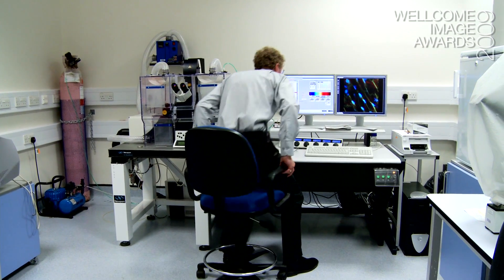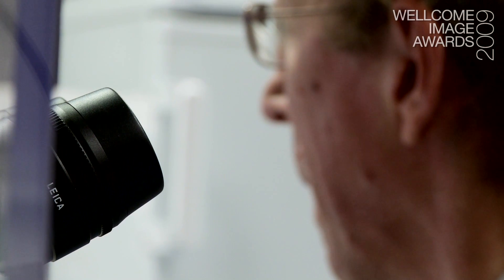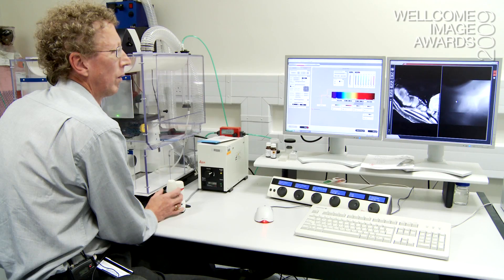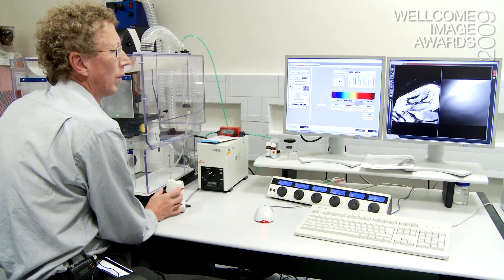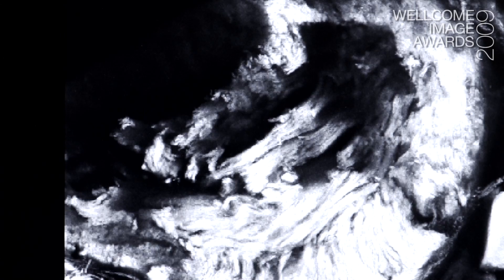An image will appear on the screen, you can then move it around, focus it, move up and down until you collect the image you're happy with and you save it. You're also able to optically slice through a sample. A bit like going up in a lift — you go through a sample stage by stage and you can go all the way through and get a series of optical slices which you can reconstruct later on to produce three-dimensional images.